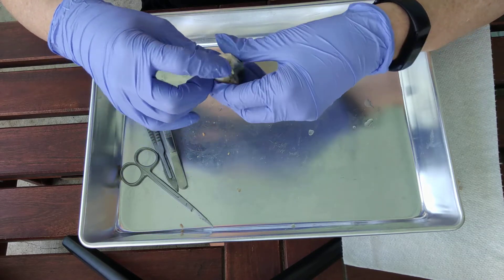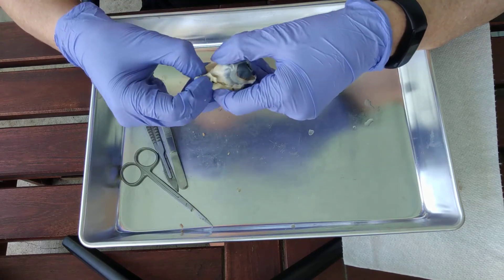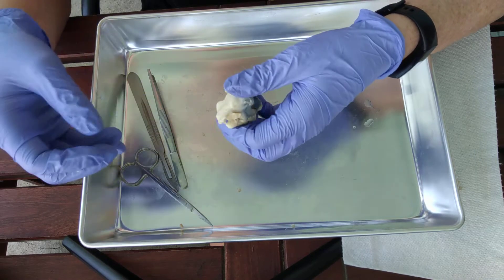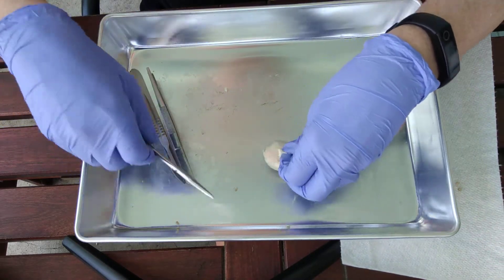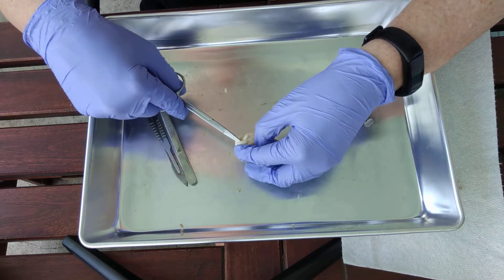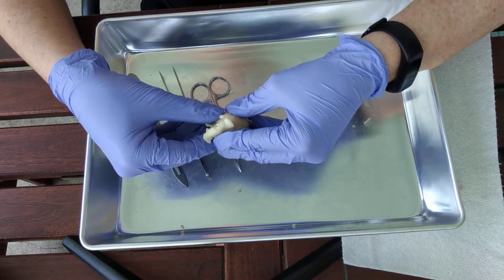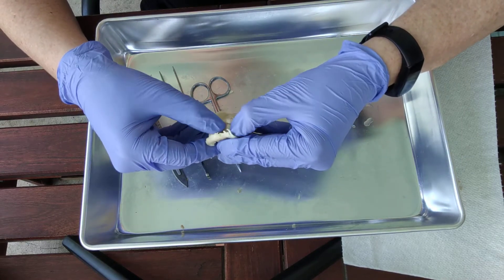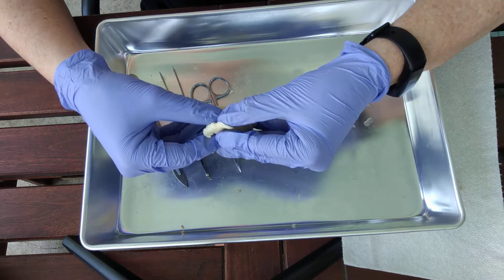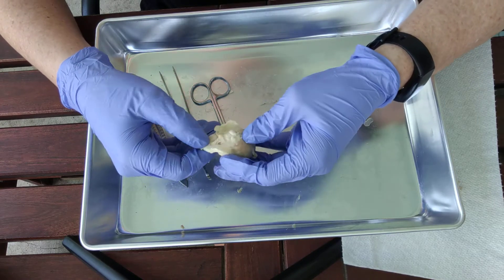Working our way towards the back — in the back here we're going to see a lot of fat. Anytime you see lumpy white stuff, all of that is fat. We want to remove a little bit of that fat to expose more of the optic nerve, which is this little structure right here. That's where the visual information would leave the eye and travel to the brain — from optic nerve to optic chiasma to optic tract and then into the brain.